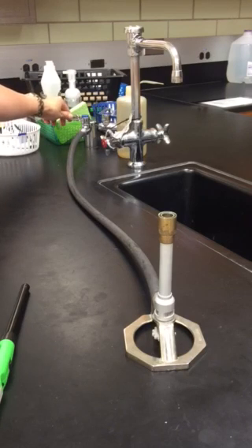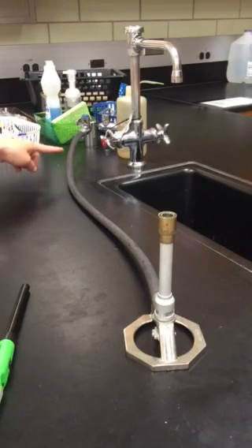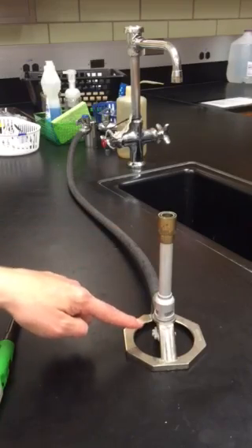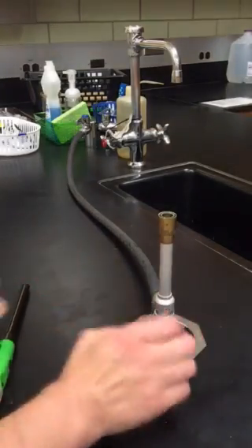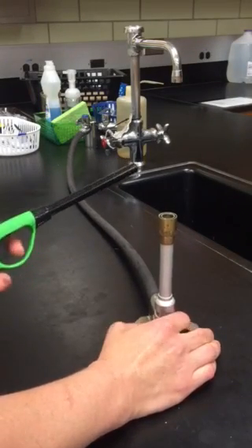I'm going to take it from the 90 degree position and turn the handle so that it's directly lined up over the jet and over the hose. Now gas is trying to get through here, but it can't because I have the gas flow knob closed. So I'm going to open that up maybe about one to two turns to the right.